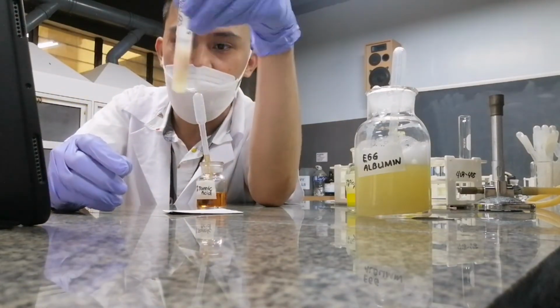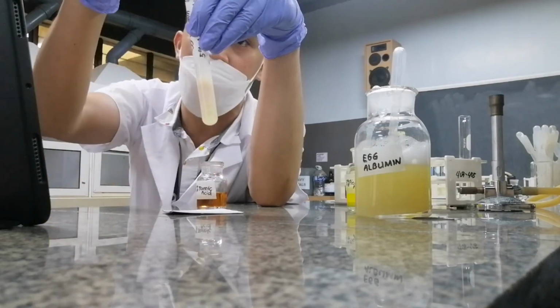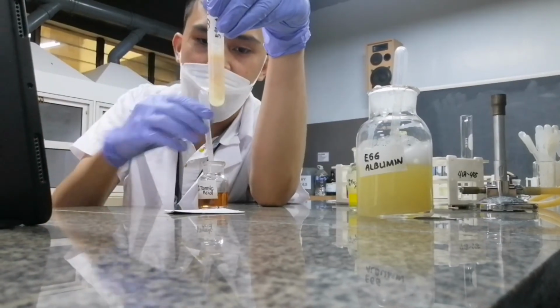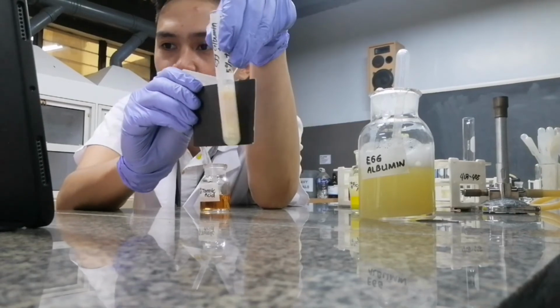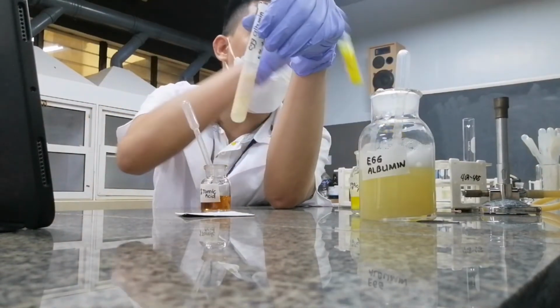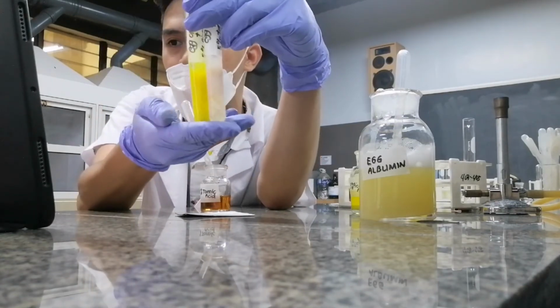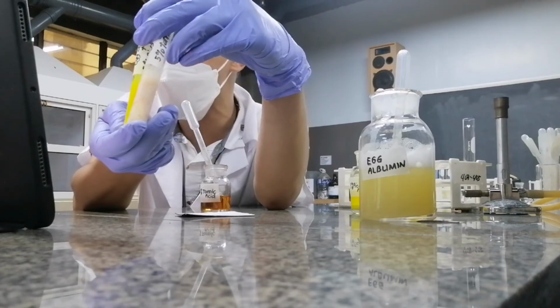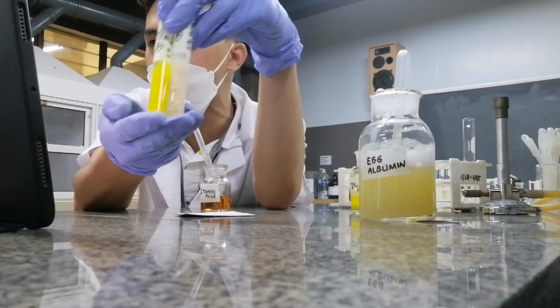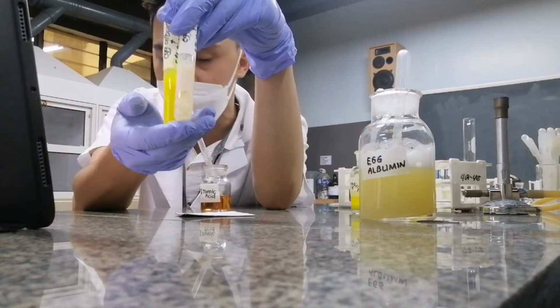Do you follow? Am I right? Because this is an alkaloidal reagent. So these are now the effects of your alkaloidal reagent. There's plenty of precipitate that we produce when we add excess of your reagent.